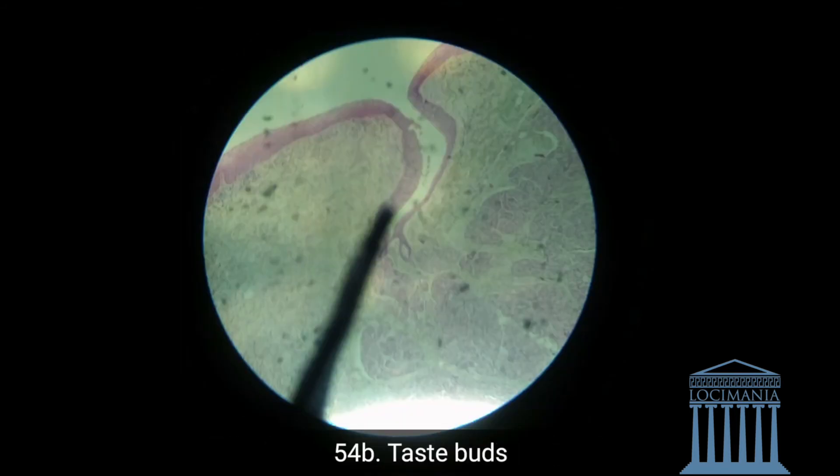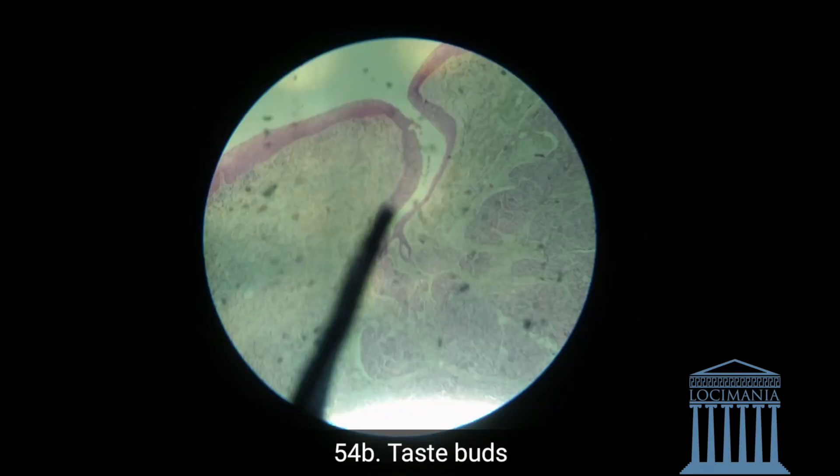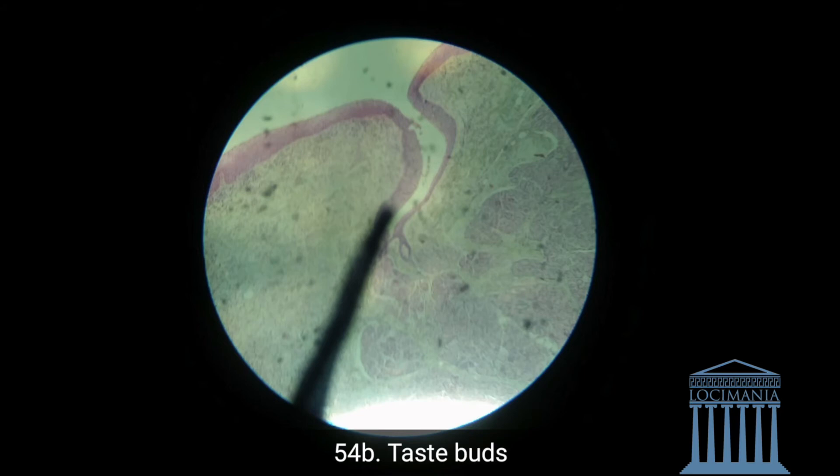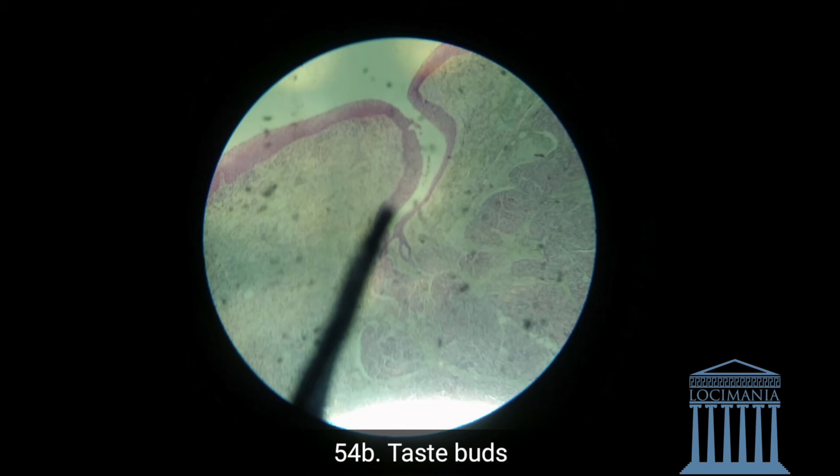On the side of the circumvallate papillae we have the taste buds. Think of the circumvallate papillae as a strawberry, and on the strawberry we always have the seeds — you know, the yellow seeds. Think of those as the taste buds.